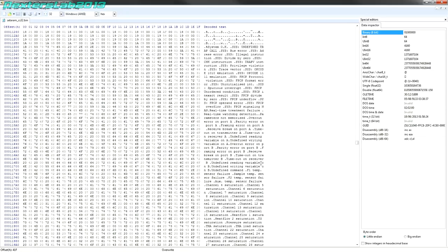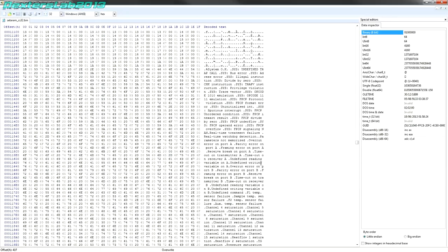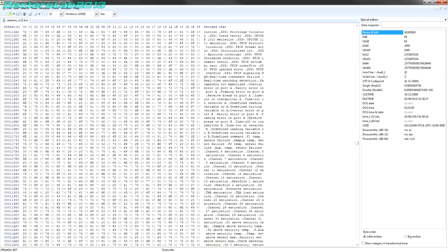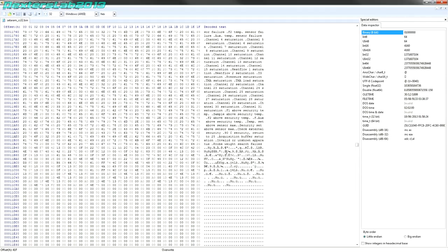Looks like the end of a block there. And there's some text. So we've got system OK, system undefined, trap call, bus error, address error, illegal instruction. So usual errors and things you're going to get on a 68,000. Spurious interrupt, real-time treatment failure, real-time watchdog detection, parity error on port A, framing error on port A, overrun on port B, undefined reading variable, blah, blah, blah. Sensor failures, temp sensor failures. So yeah, there's all sorts of monitoring stuff going on here.